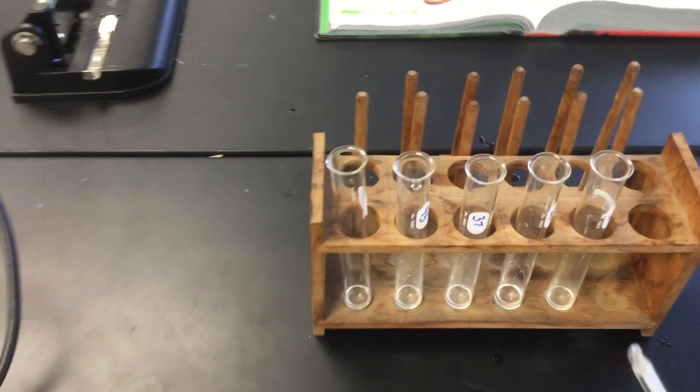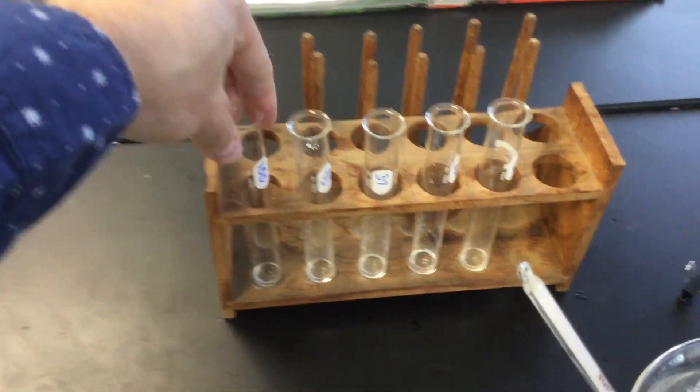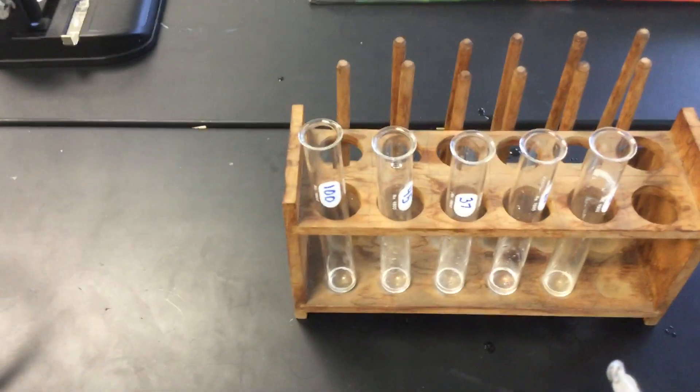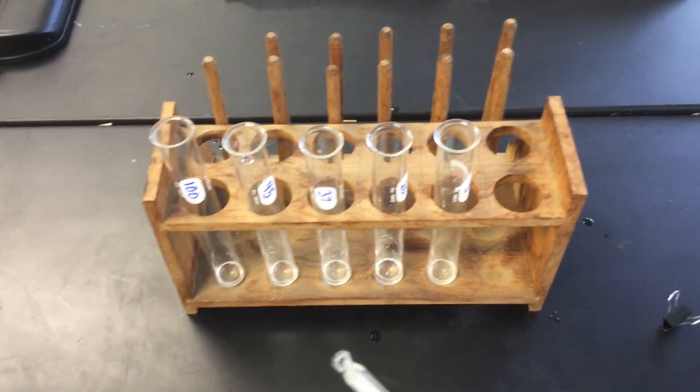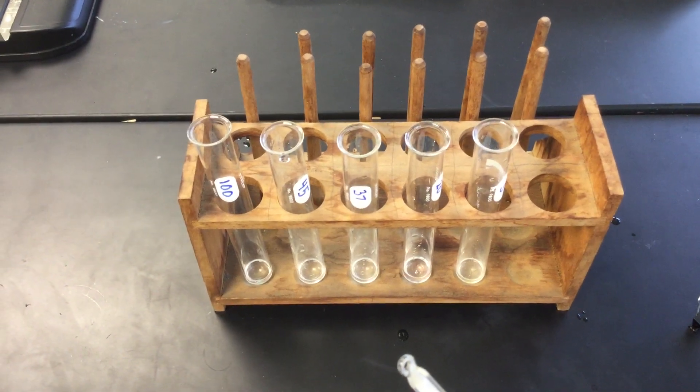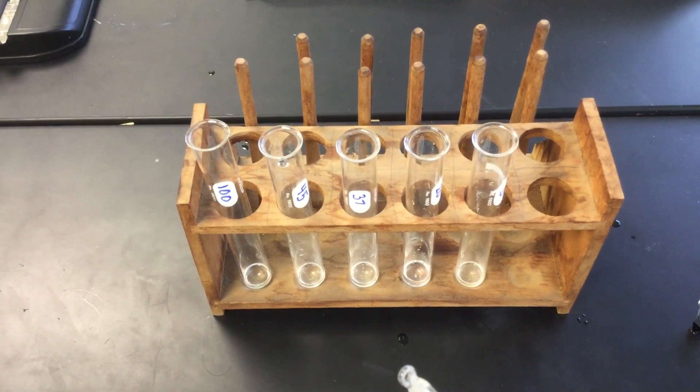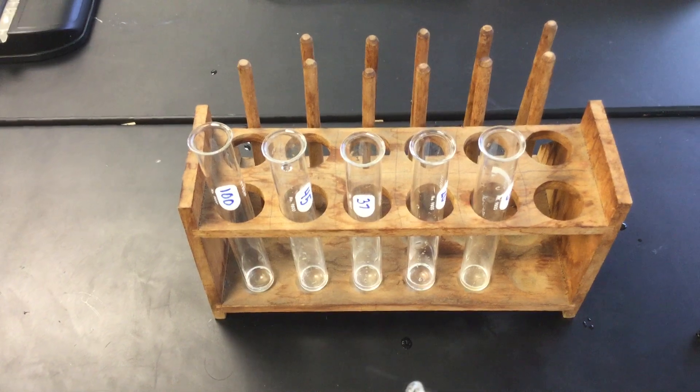It's hotter than 100 because it's probably not pure water. And then what I have here are flasks or test tubes that will be set for these different temperatures. And in them right now is about 2 milliliters of starch.